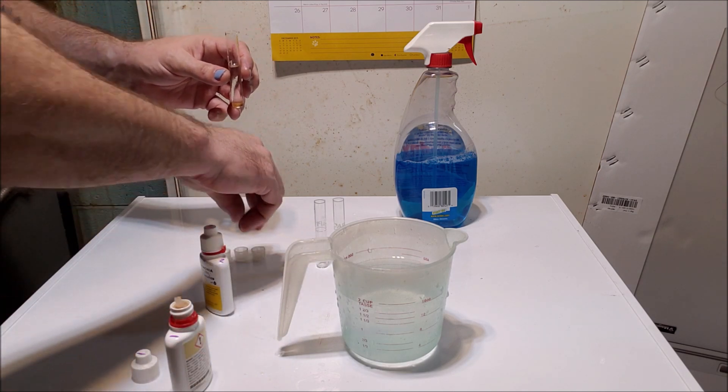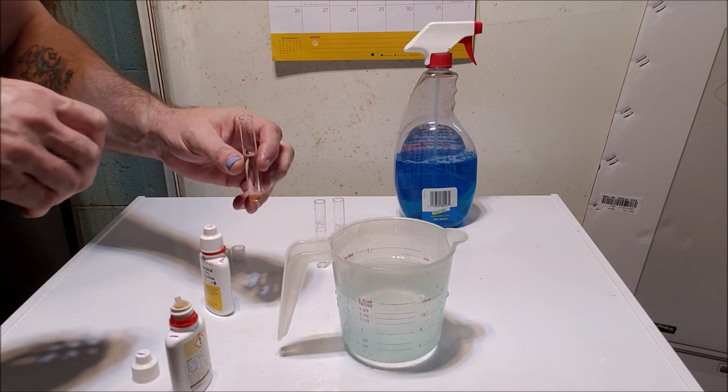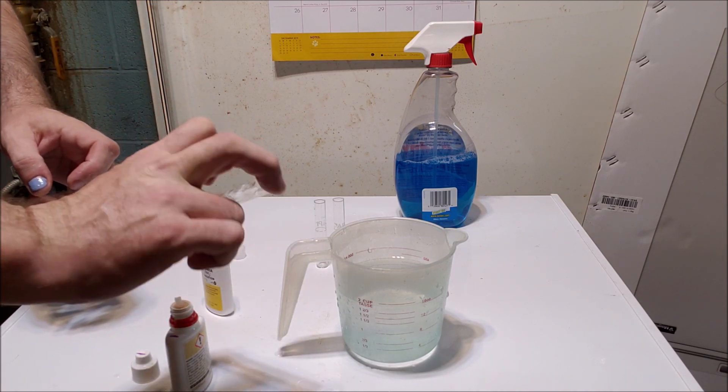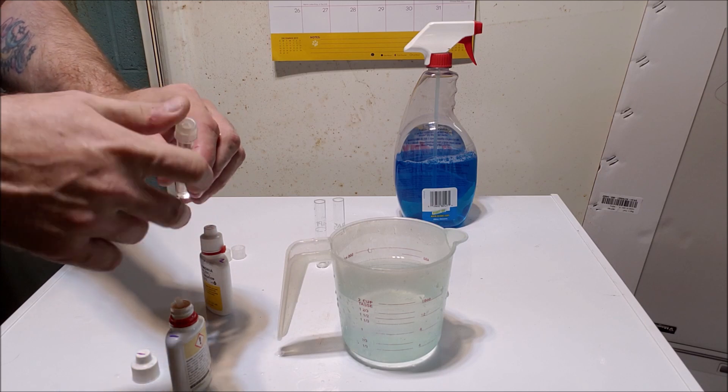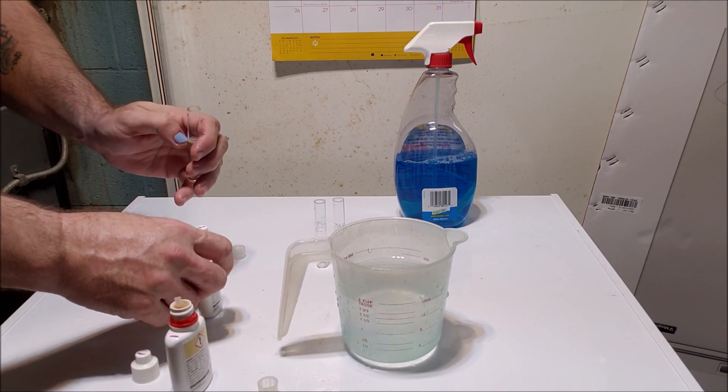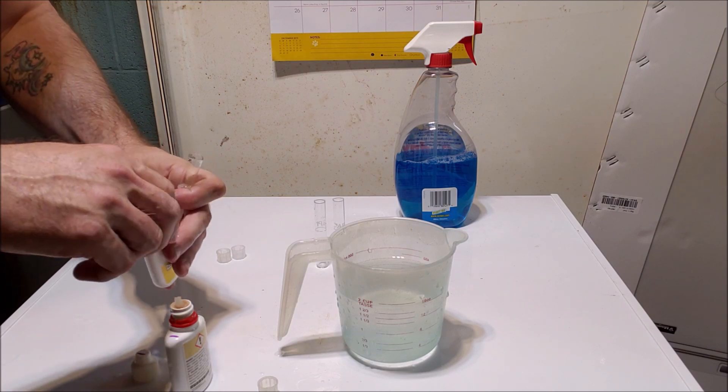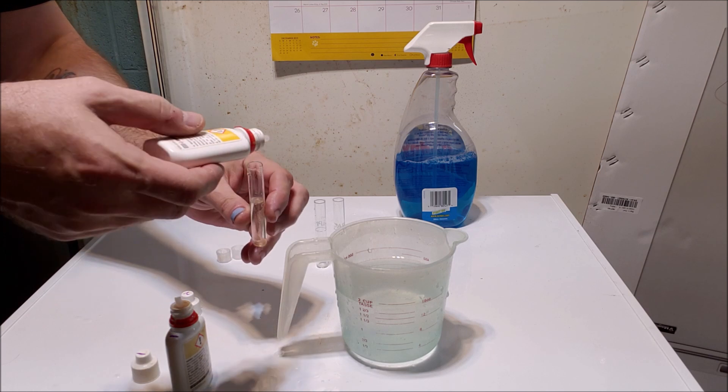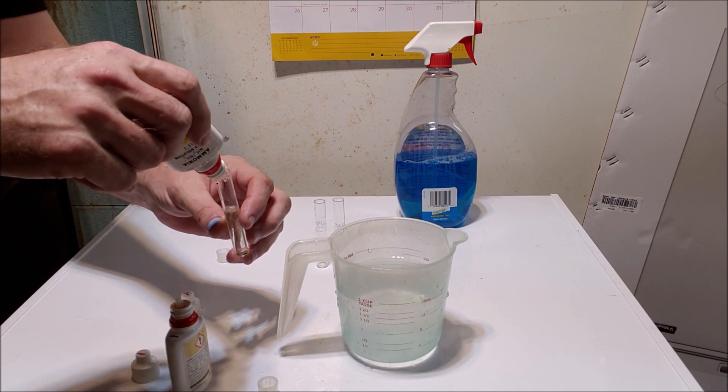I don't know if I'm casting shadows over that or not, I'm trying to get this all on camera so you can see what I'm doing. We're going to shake the first reagent, mix that in. I don't believe the instructions say to do that, but I did have somebody tell me the other day that I needed to shake the first reagent before putting the second one in. I know that applies or theoretically applies to the nitrate test.